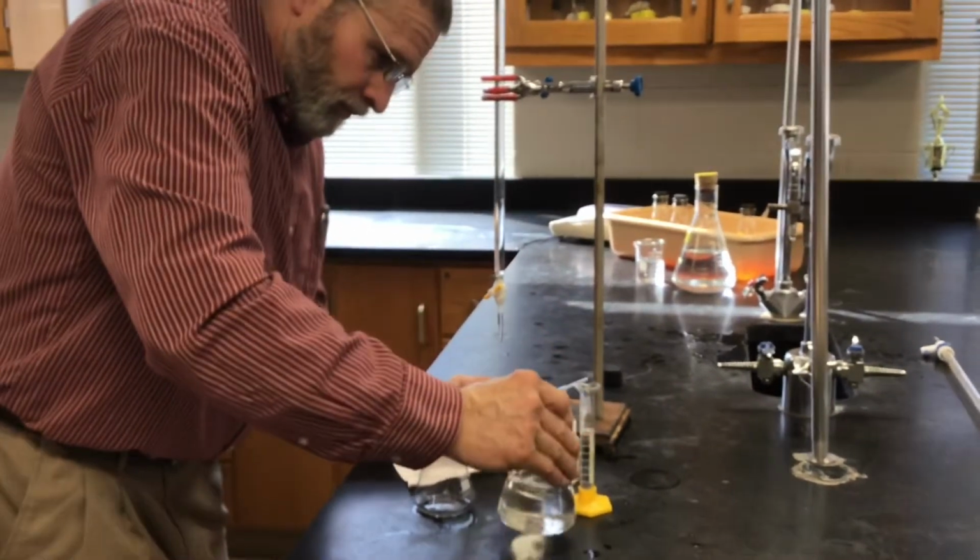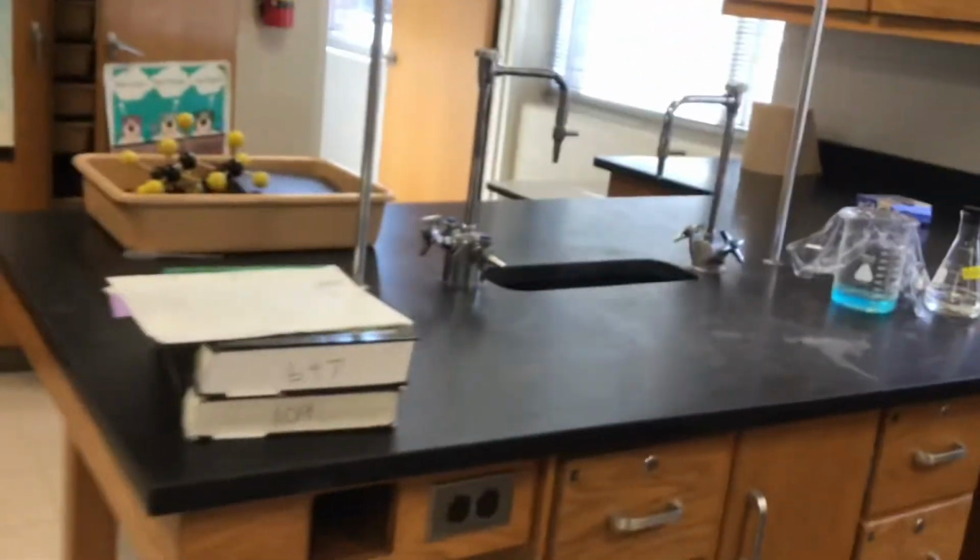Oh, we didn't read the volume. That would have been bad. Yeah, let's make sure we get that.